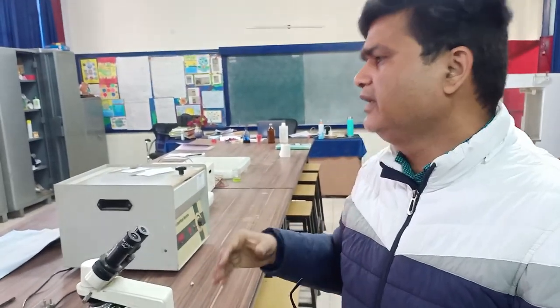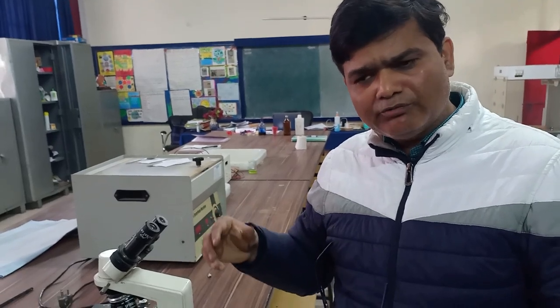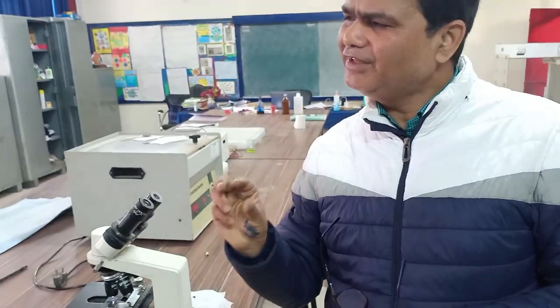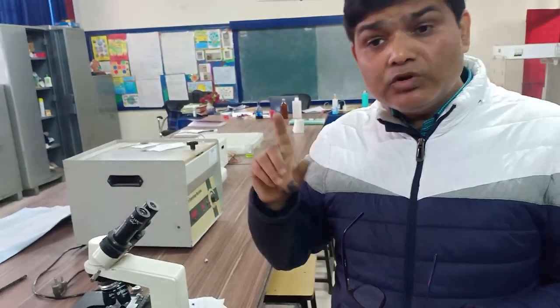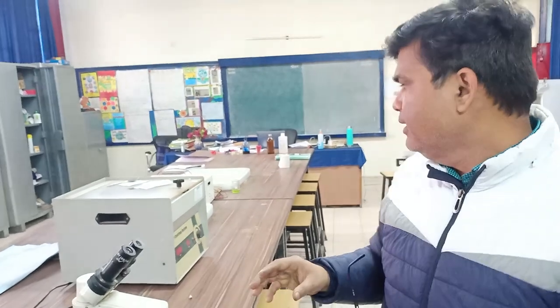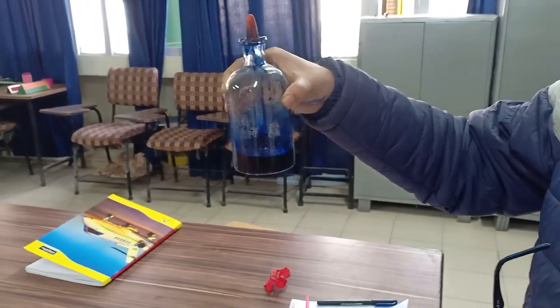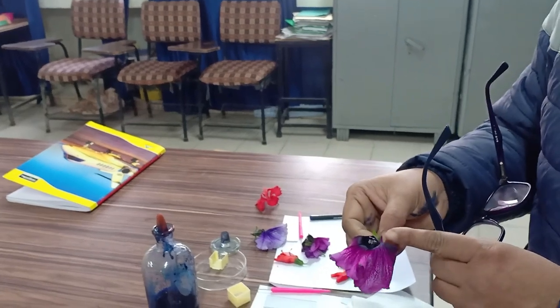To prepare the Evans blue solution, use 0.4 molar sorbitol and 0.1 gram Evans blue. Dissolve first in ethanol, then make up the volume to 100 ml or 50 ml as per your requirement. If you do not prepare the Evans blue solution properly using 0.4 molar sorbitol, you will not be able to differentiate whether the pollen grain is living or non-living inside the anther.